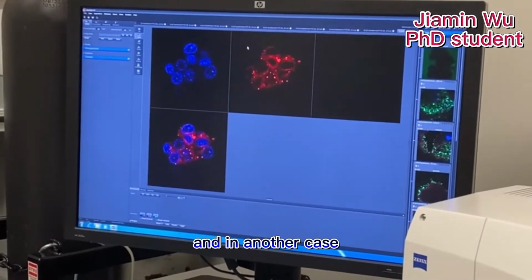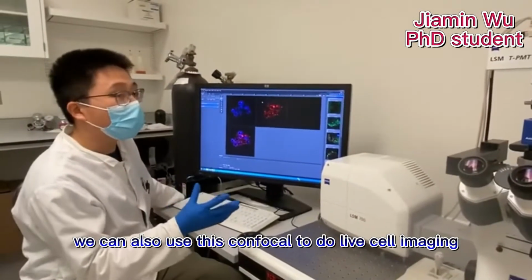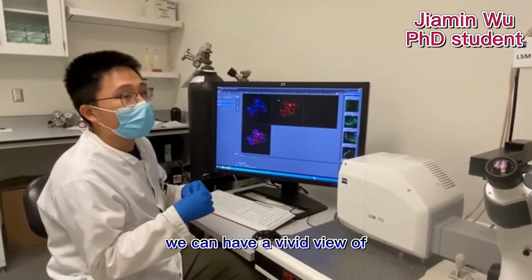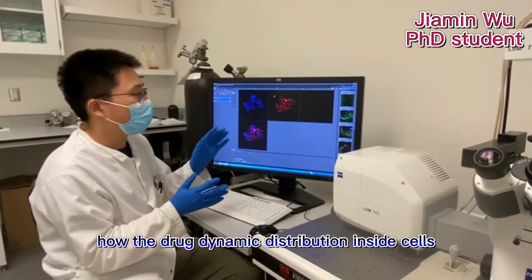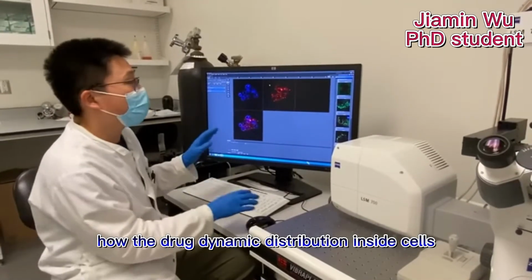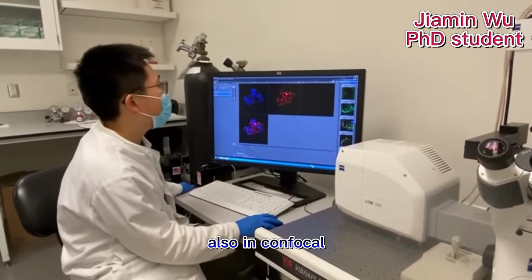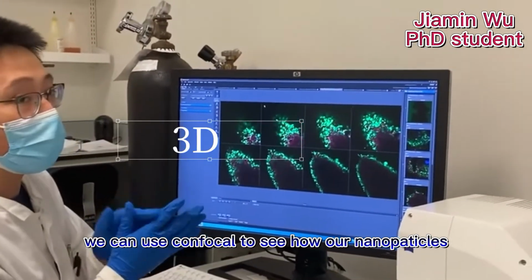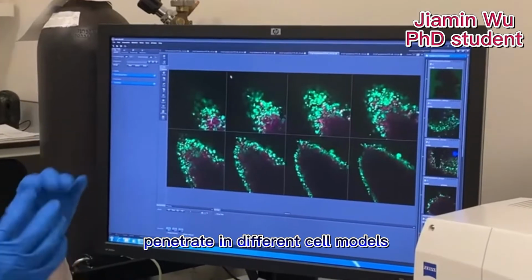In another case, we can also use this confocal to do live cell imaging. In live cell imaging, we can have a vivid view of how the drug dynamically distributes inside cells. Also, in confocal, we can see how our nanoparticles penetrate in different cell models.